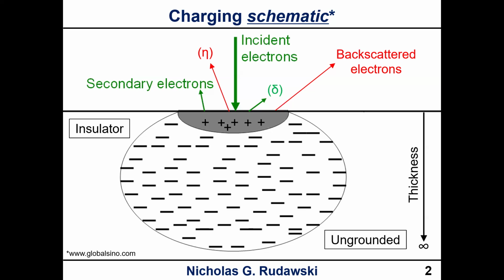But then in the bulk, we may end up with the reverse, which is a negative charge distribution, because not all of those electrons that I shoot in actually make it out or are backscattered. Many of them aren't, depending on the material, and those will then sit inside of the sample, especially if we don't have any path to ground. Again, we're assuming an insulator, no grounding, and the sample is infinitely thick.